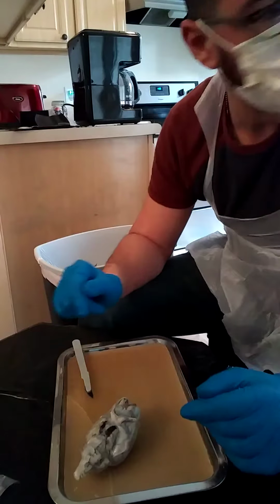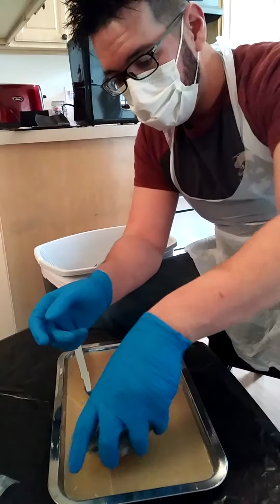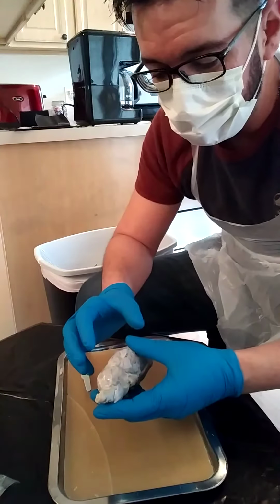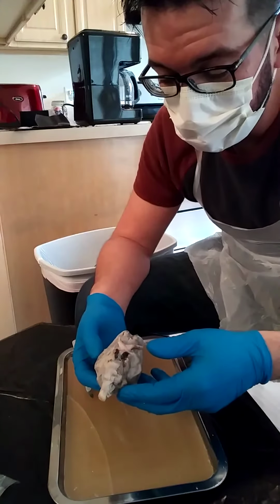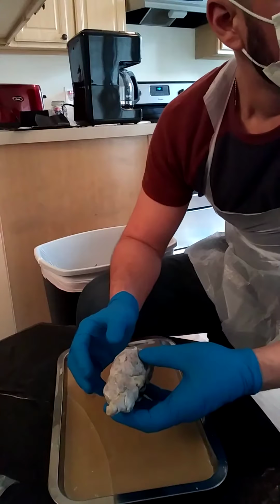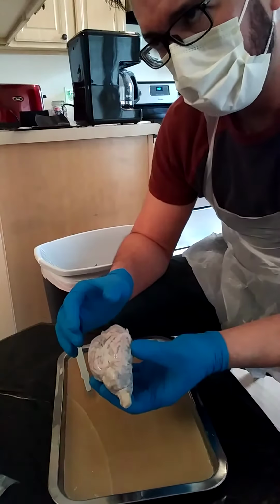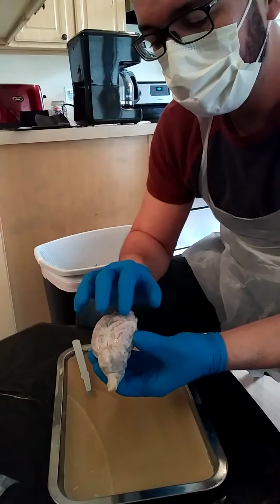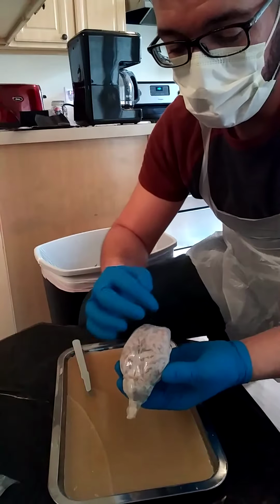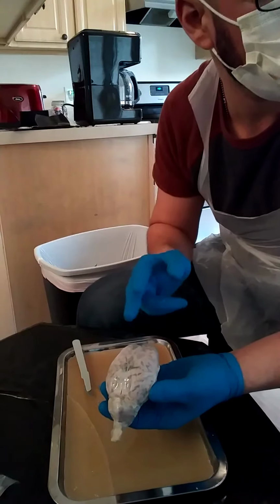Let's at least begin with the parts of the sheep brain, the external anatomy. We first have the dura mater. The dura mater is the covering on the outside of the entire brain, so technically everything here is the dura mater. The cerebrum is the two main lobes, the right lobe and left lobe of the cerebrum. The longitudinal fissure is the center cut that separates the two parts of the brain.